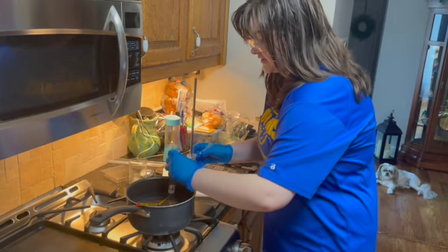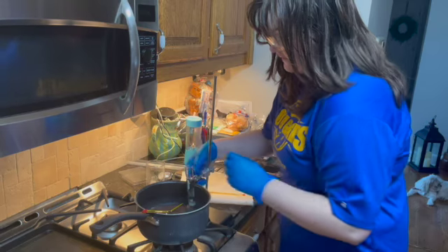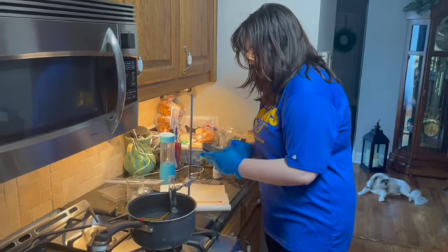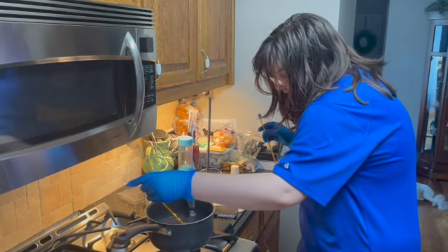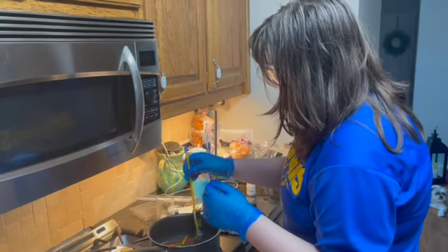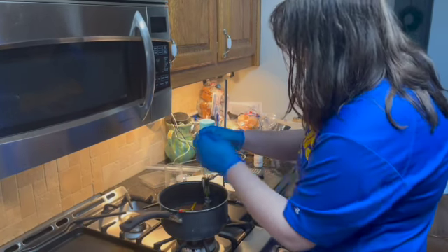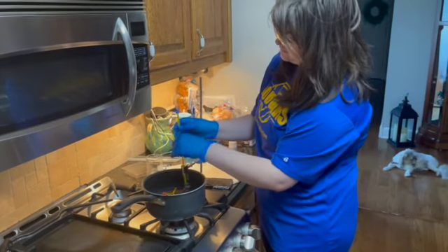Okay, so I just added 1.53 grams of naphthalene into the solvent, which was 6.55 grams of paradichlorobenzene. That was completely melted, so I'll be starting the timer now. At the beginning of this, my hot bath is at 55 degrees Celsius, and I'll be checking and agitating a little bit my solution of naphthalene with my paradichlorobenzene, and it is at 41 degrees Celsius at the 0 minute mark, just beginning.